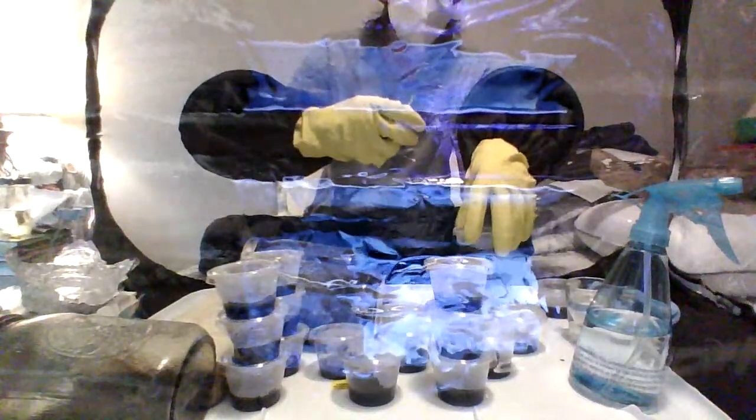Where's my trenchers? Here they are. All right, so I was just going to do one more, and I meant to do it in a condiment cup and then put it in the other jar. So we're gonna do one more on this condiment cup. I have my contaminated sample. Open it up.